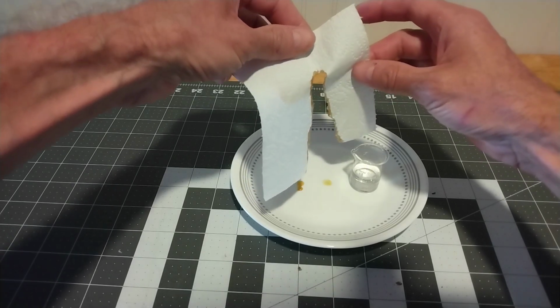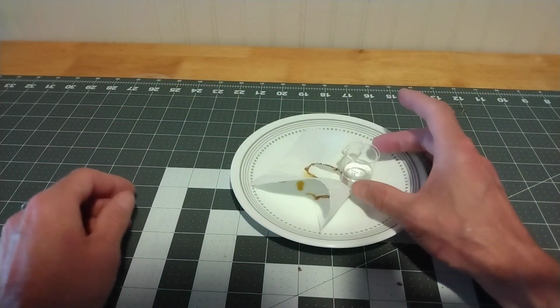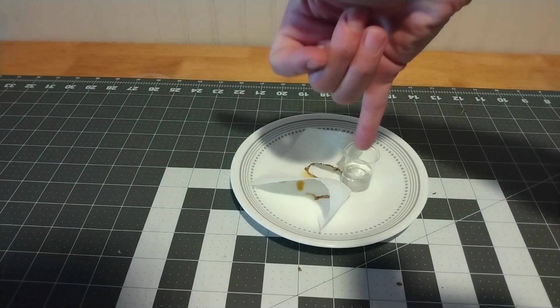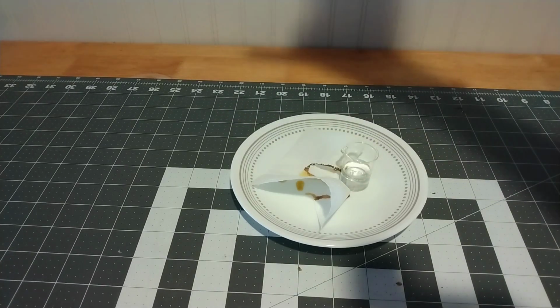All right, 98% sulfuric acid. Challenge accepted. Now go ahead, dip your finger in your safe boiling water.